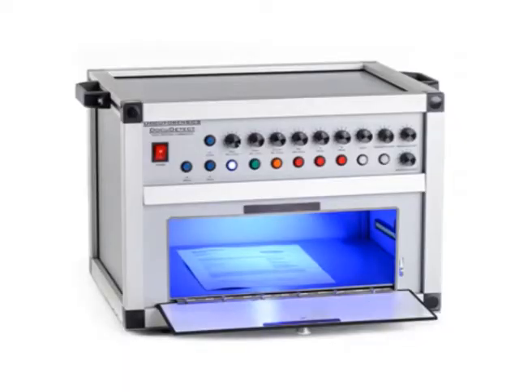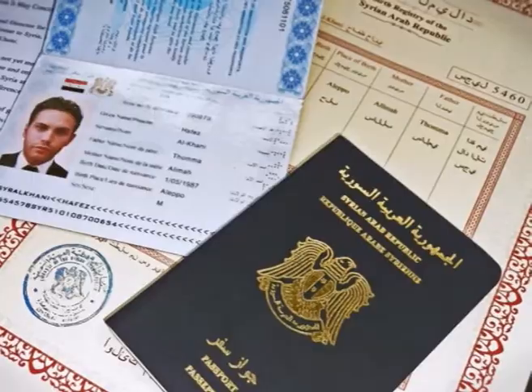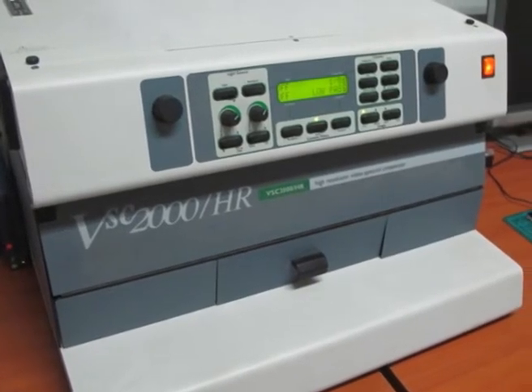VSC updated software is integrated with the document database system with a single user license that enables the operator to generate their own database and access and display data from the Keesing reference database of security documents. Keesing is a reference database of security documents — passports, ID cards, driving licenses from 180 countries, comprising images and data. VSC is one of the latest systems incorporating advanced technology in the field of questioned documents. It is a highly versatile system providing the question document examiner with an extensive range of facilities for detecting irregularities on altered and counterfeit documents.